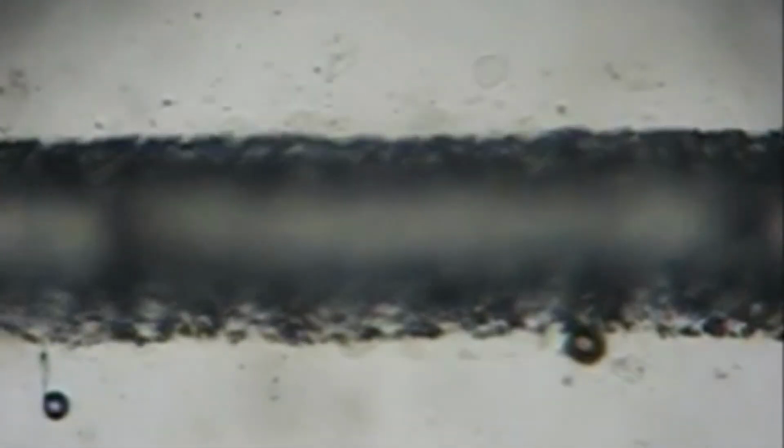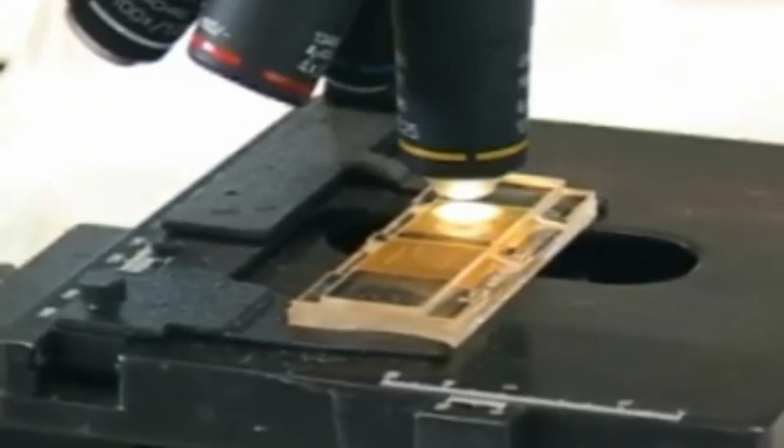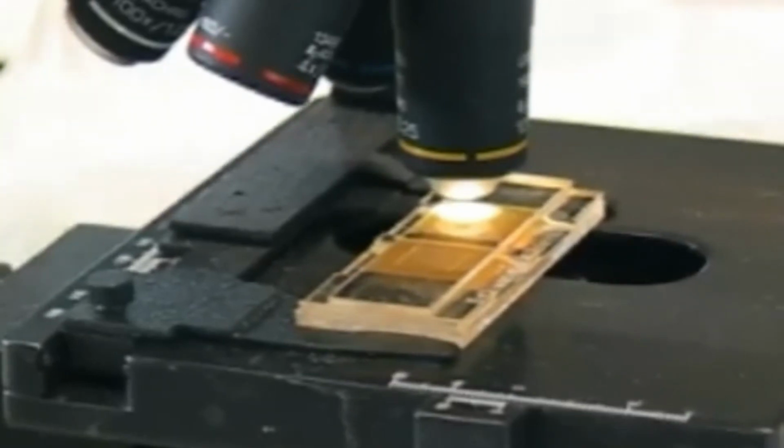Start with focusing the microscope on one of the grid lines, after which you focus on the air bubbles, which are round in appearance and have a black outer ring and a clear center. Now systematically scan all the columns of both the chambers. Eggs that lie outside the chambers are not to be counted.